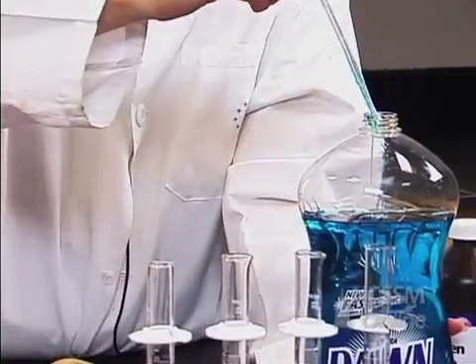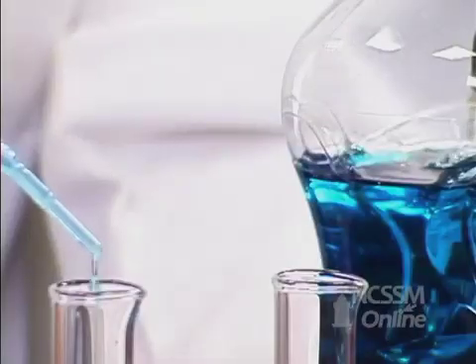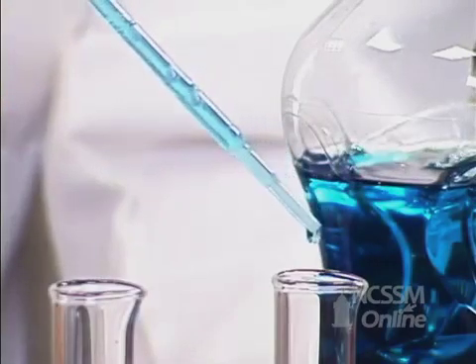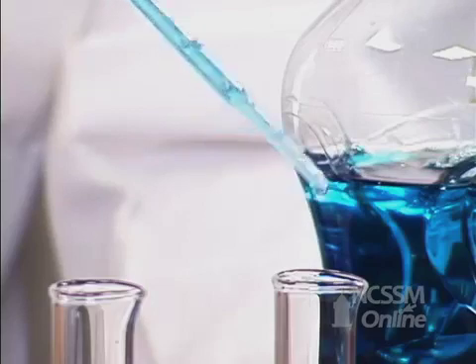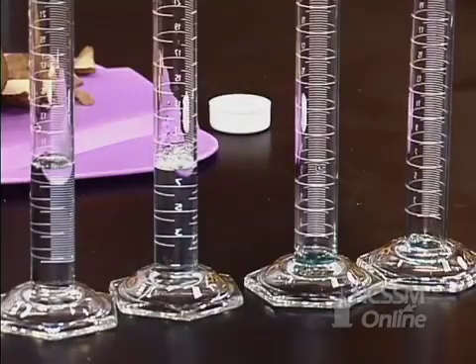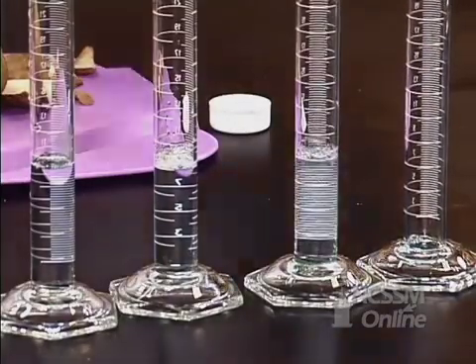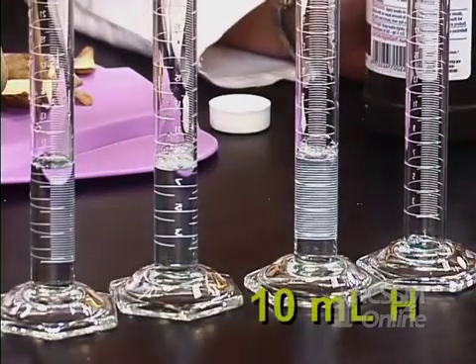In order for us to see the oxygen gas produced, I'm going to put four drops of detergent in each of our graduated cylinders. And then I'm going to add 10 milliliters of hydrogen peroxide.